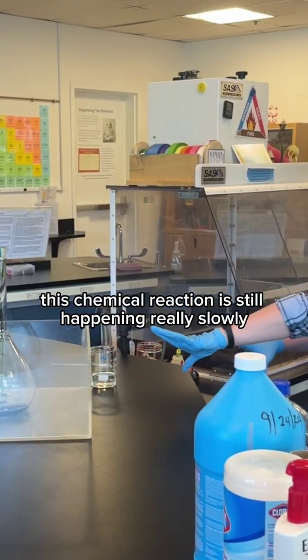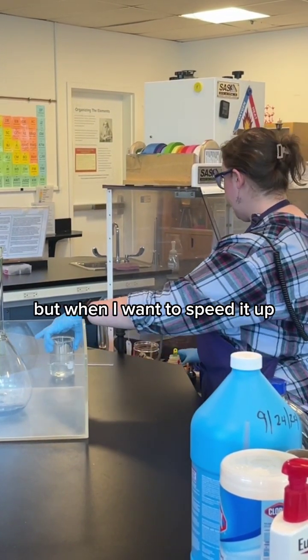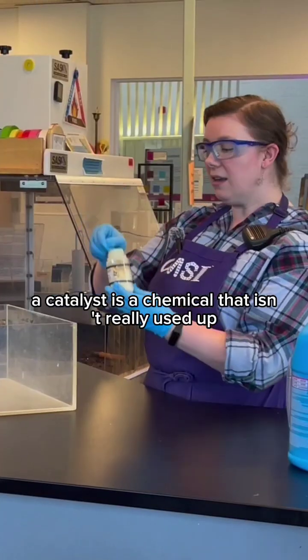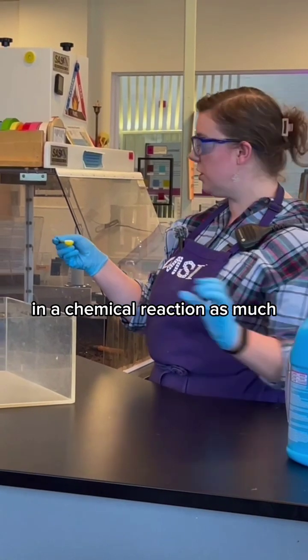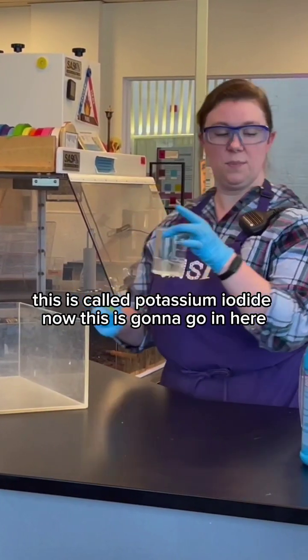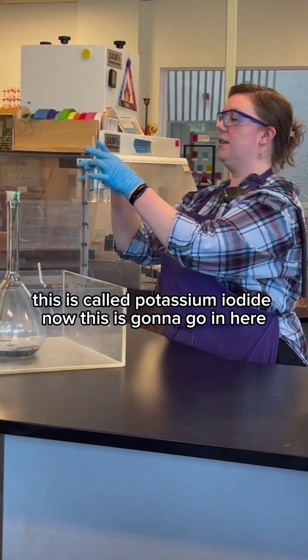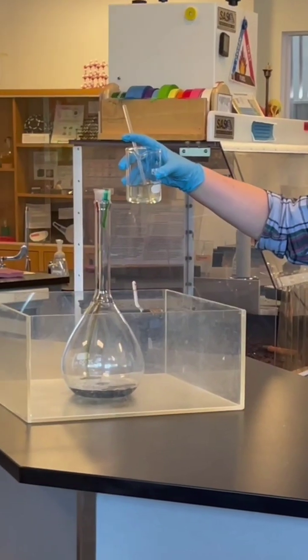This chemical reaction is still happening really slowly, but when I want to speed it up, it's time to add a catalyst. A catalyst is a chemical that isn't really used up in a chemical reaction as much, but it speeds up a reaction that's already happening. This is called potassium iodide. Now this is going to go in here, then it will get exciting. Ready? Let's do this.